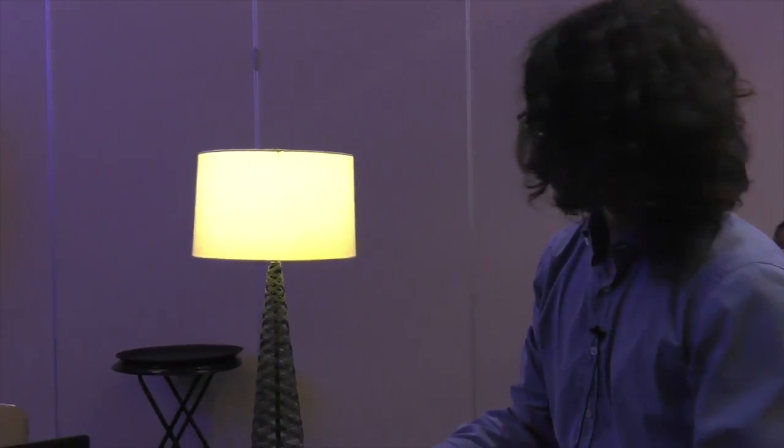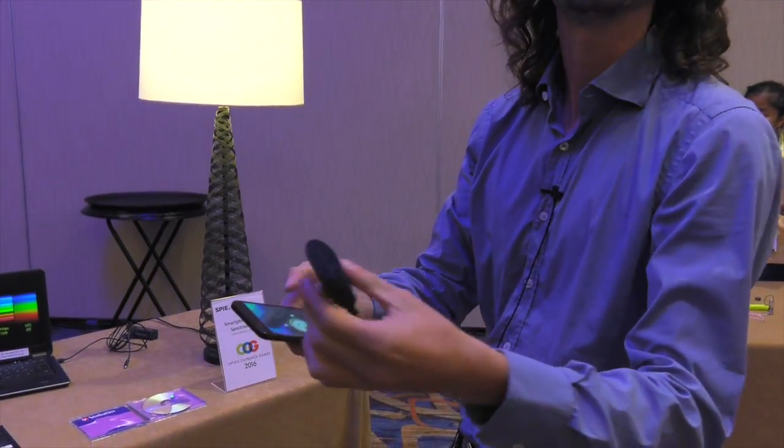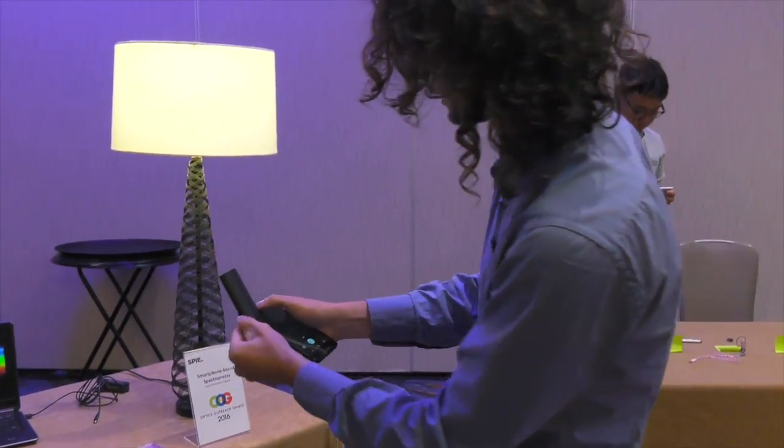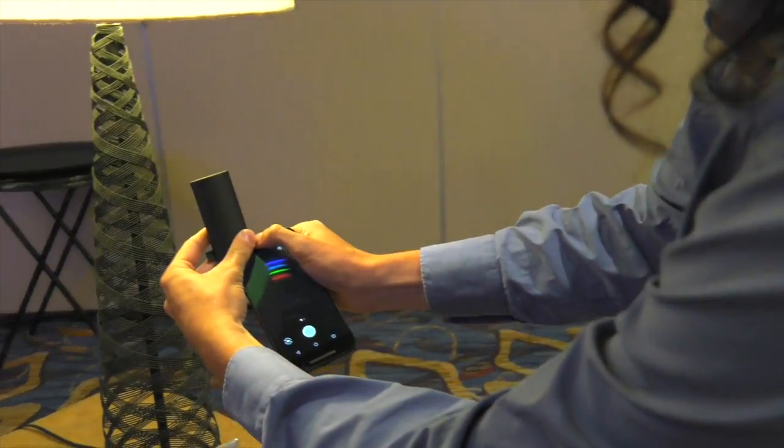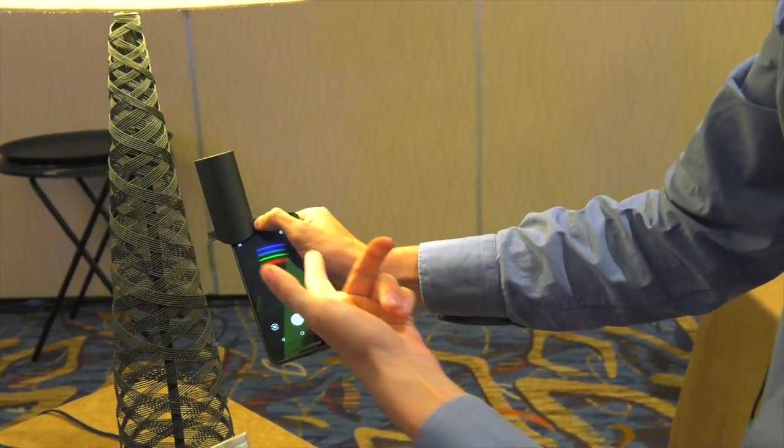We take the smartphone. I turn on the front camera in this case just to show better. And if we go to a lamp and we align it better, we can see the spectrum of the lamp, different wavelengths.